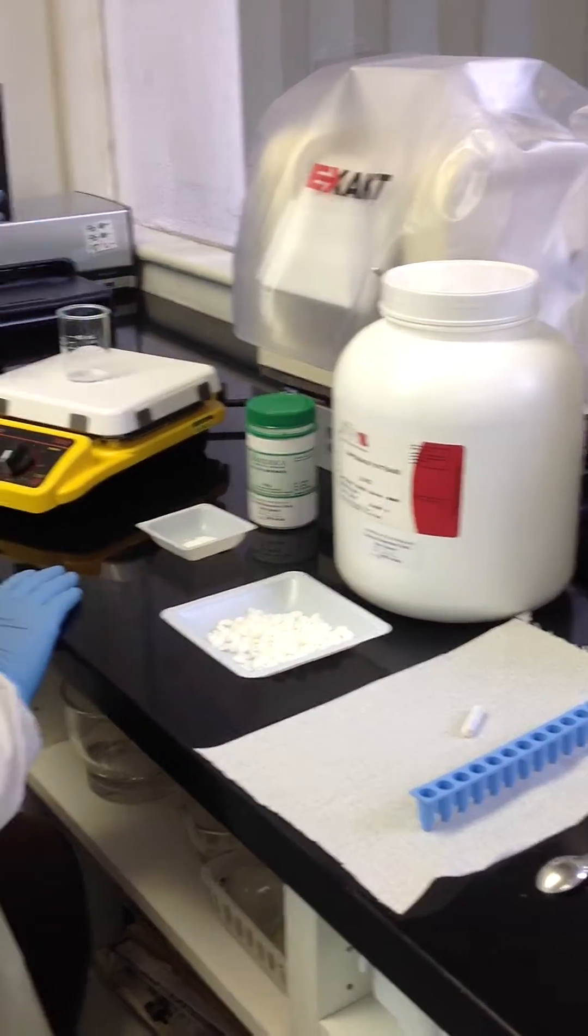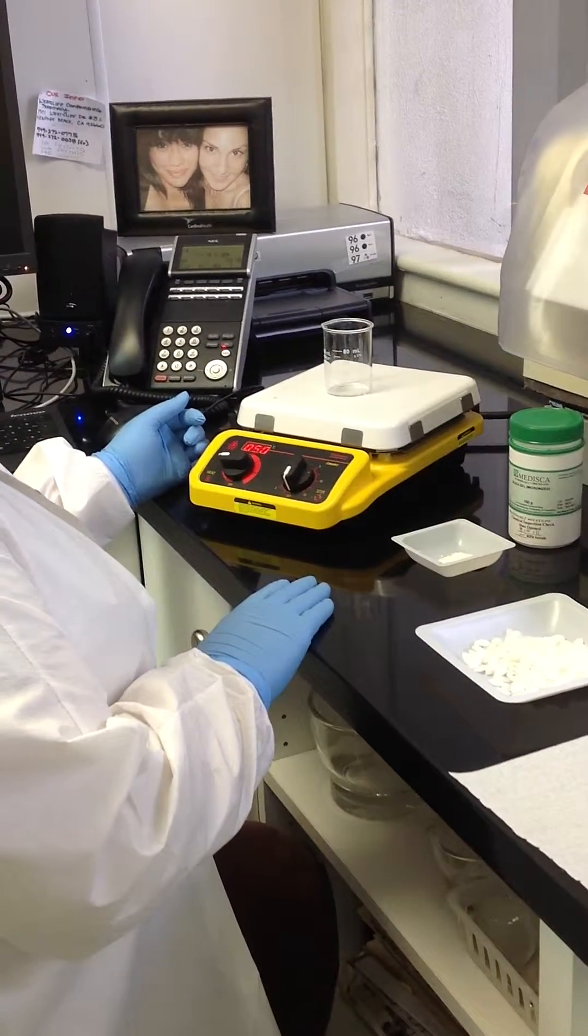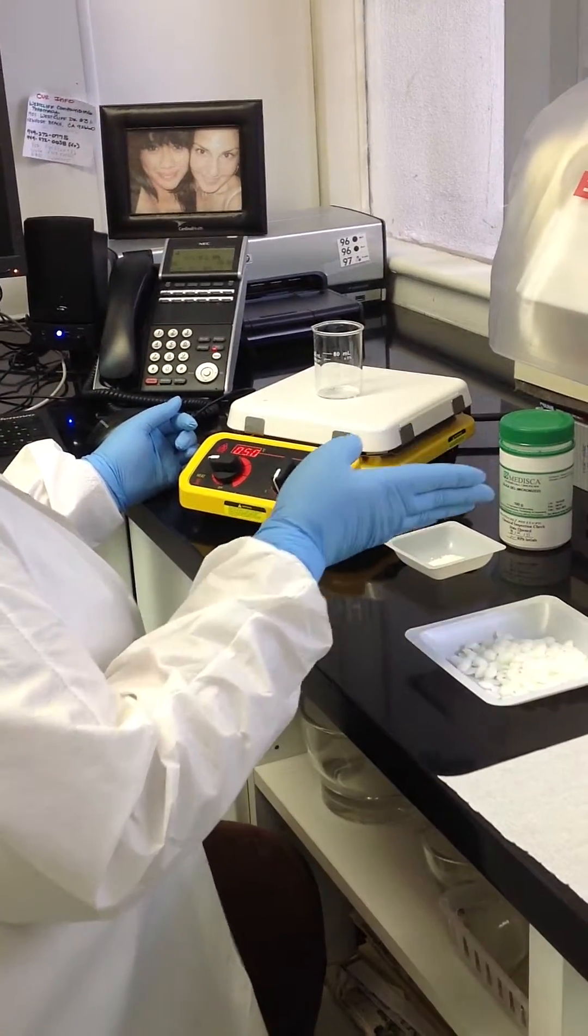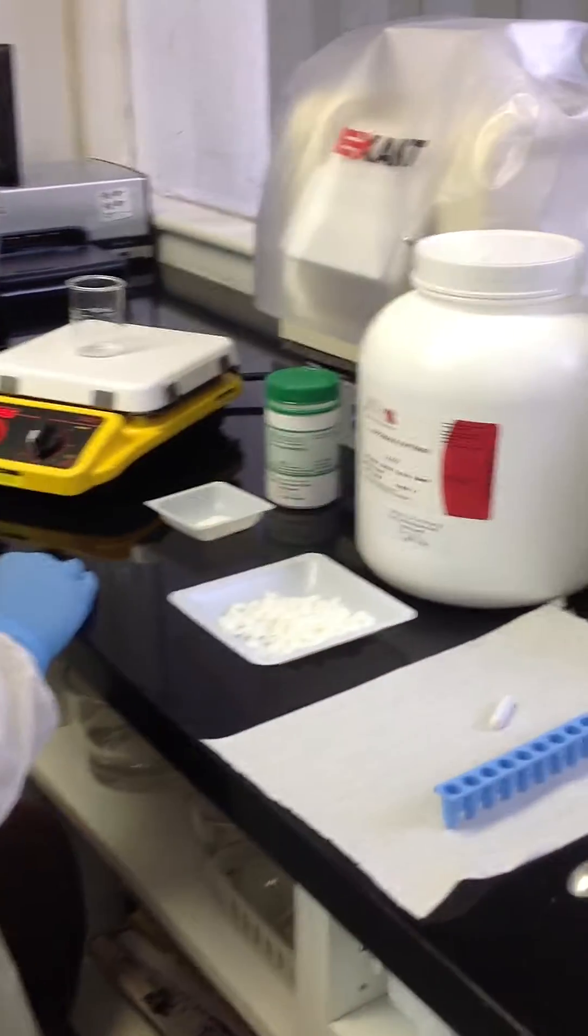We have our hot plate stir plate, currently at 50 degrees Celsius. The suppository base melts at a minimum of 40 degrees Celsius, so that's a good temperature to have.